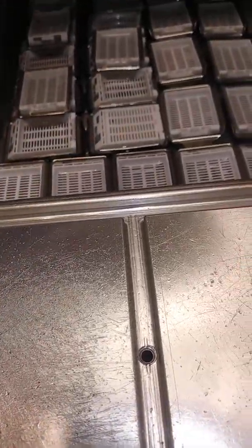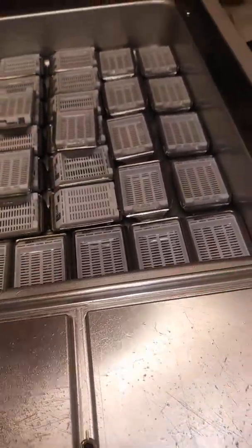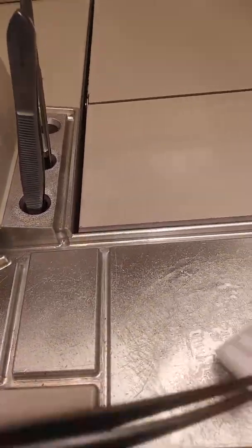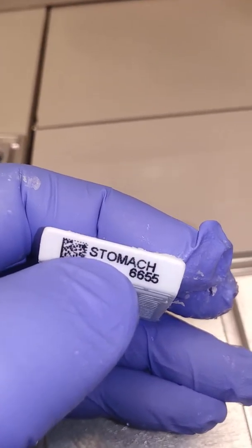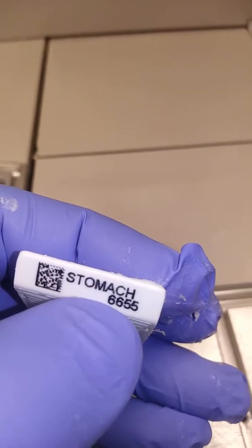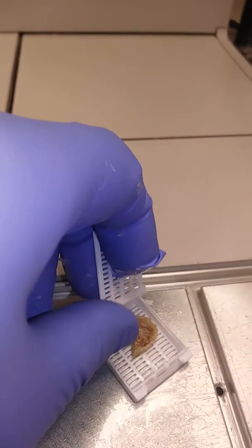The tissue usually comes like this in the cassette. This is a patient identifier — we don't usually have the specimen site but this one has a barcode here. When you scan it, the patient name should come up and the case number should come up. So let's embed this — this is stomach, as you can see.